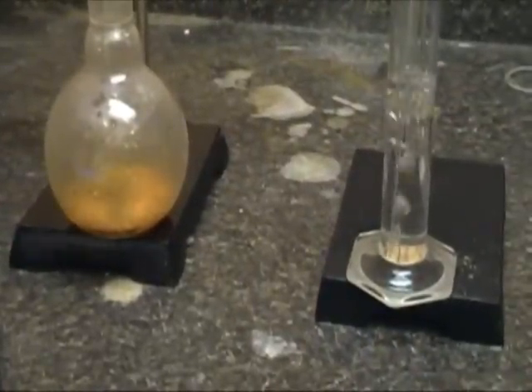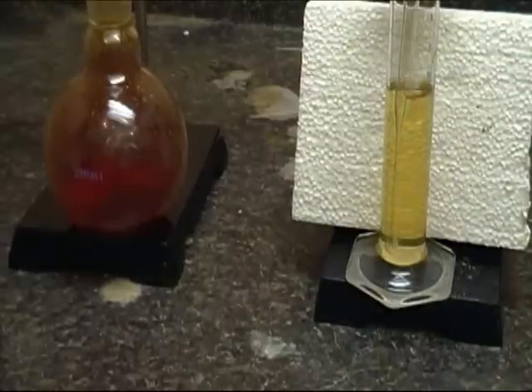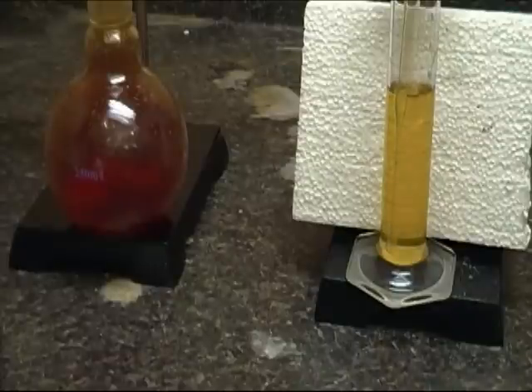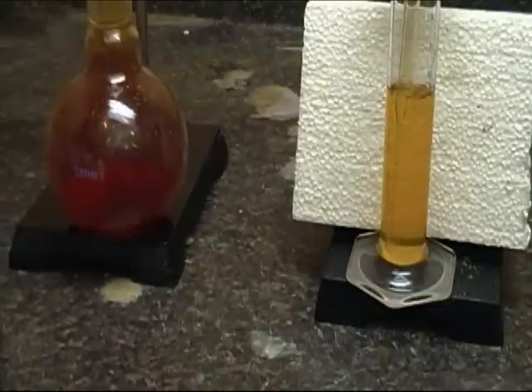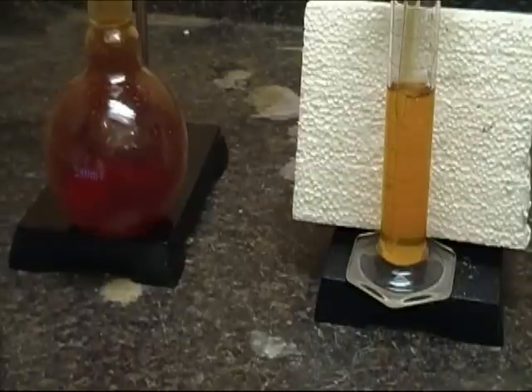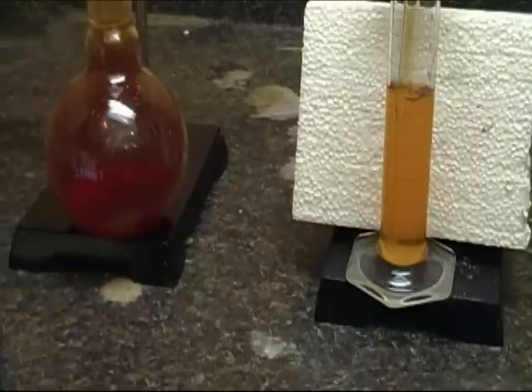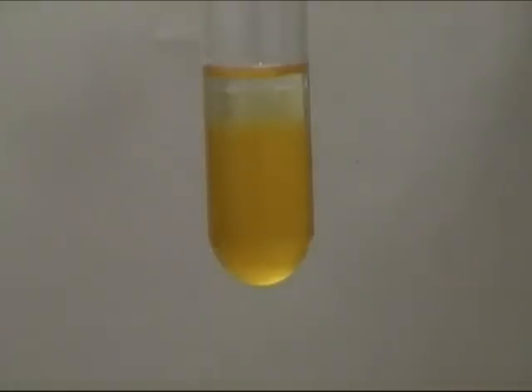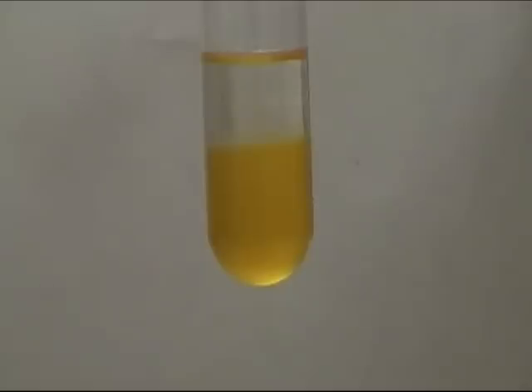We are fast forwarding through the reaction to show the dichloromethane changing from a clear liquid to a light red liquid. Once I felt I had enough, I stopped adding the acid and let it sit until no other gases were bubbling out. Bromine is not the only gas dissolved in the liquid — it will also have some sulfur dioxide and maybe even a small amount of acid. I found that pouring the liquid would release the dissolved sulfur dioxide and some of the bromine, so please be very careful in handling. You only need a small amount of the solution to do the test. Mount it to a stand like this and then start adding in your cyclohexene drop wise, shaking occasionally.